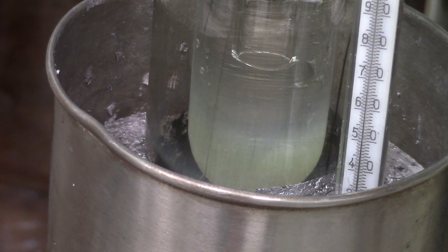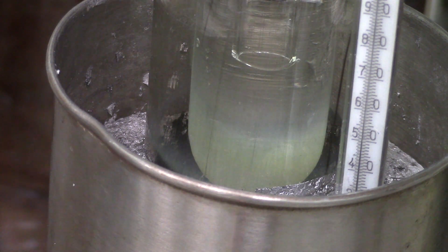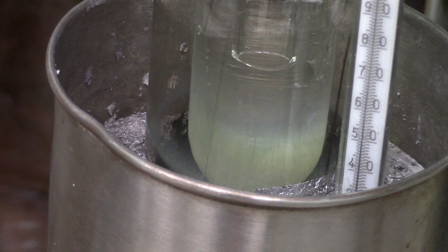Chilling with water producing crystals of purified solid. Different molecules have a different sublimation temperature so you could isolate them from each other. For this method, successful separation is achieved with a phase temperature difference of at least 10 degrees Celsius.